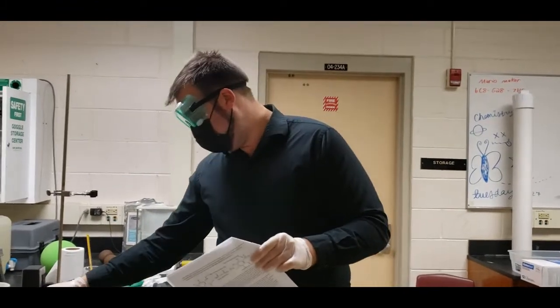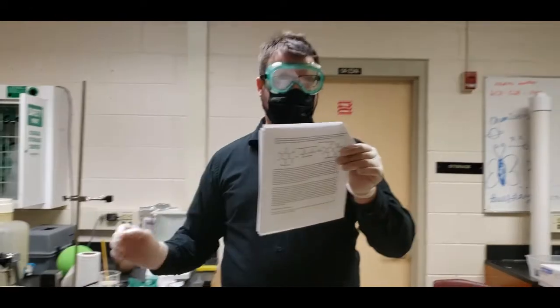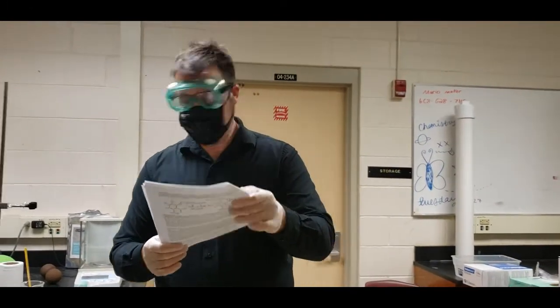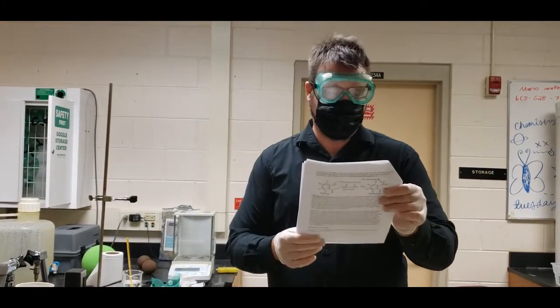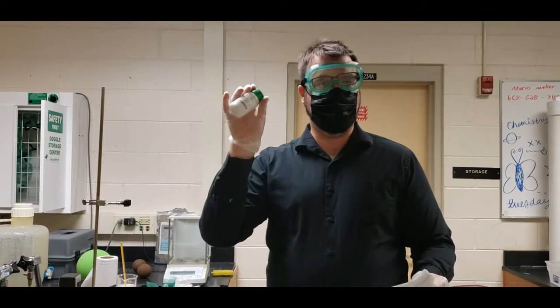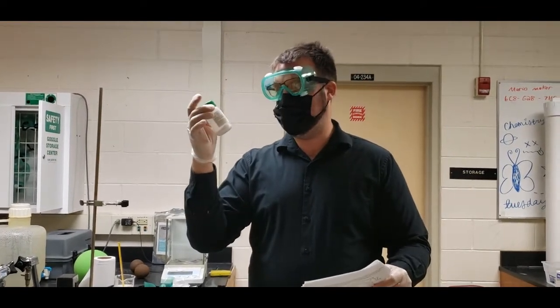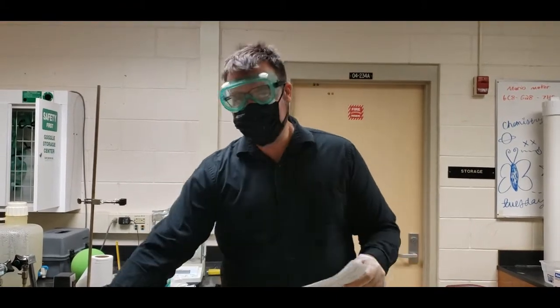Then we're going to have our ethyl alcohol that can stay at the table as well. Make sure that that is far away from any heat sources. Our iron 3 chloride, we can go ahead and keep that at our table. We have our base, which we are going to make our acetyl salicylic acid from, which is going to be our salicylic acid.